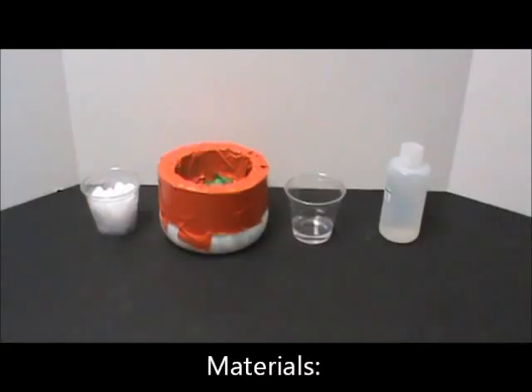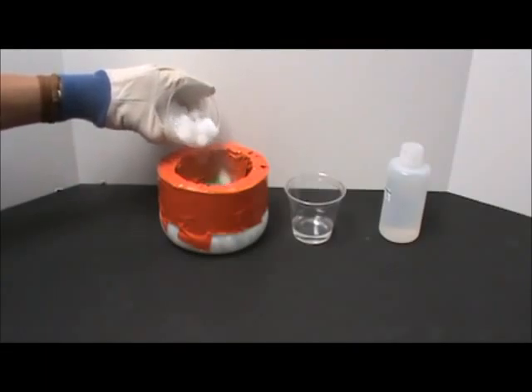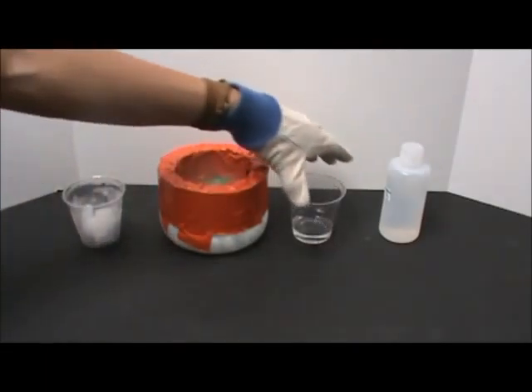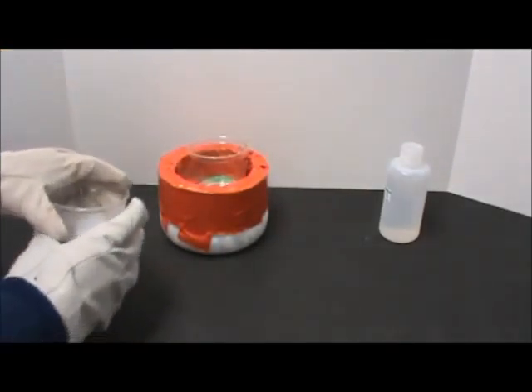Introduction. Demonstration. For this demonstration, team members will need dry ice, a plastic dewar, and a cup with a small amount of water in it. Pour half the dry ice into the plastic dewar. Then place the cup of water inside and pack dry ice around it.